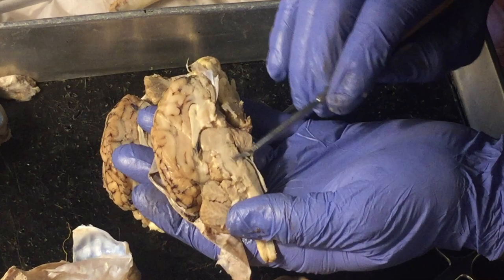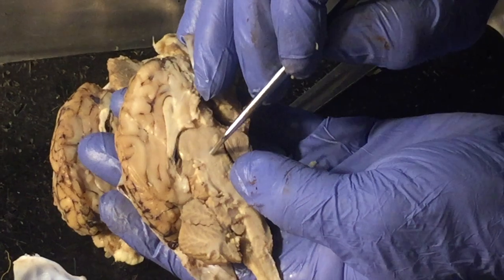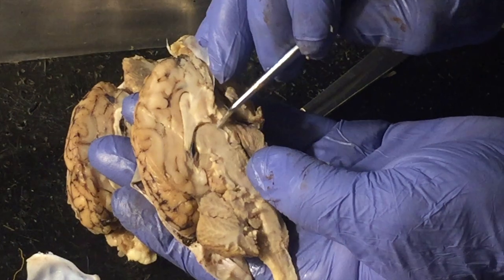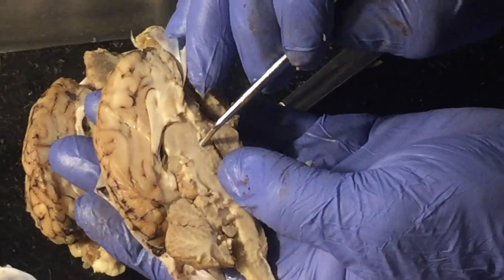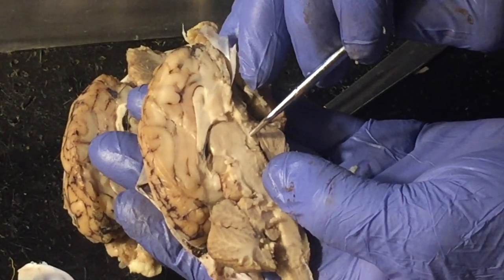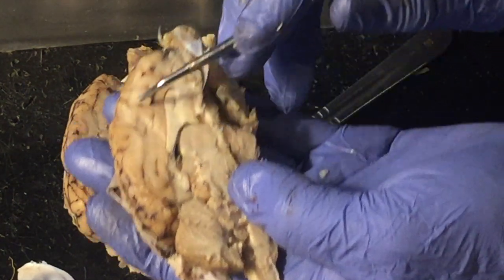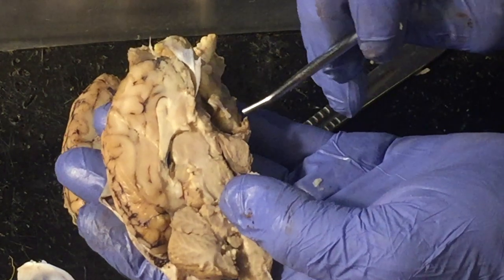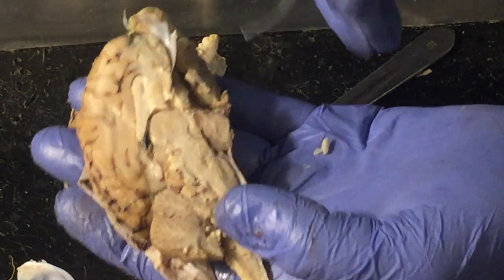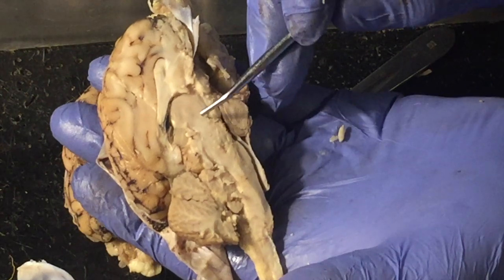The next structure that I want to show you is the thalamus. If you can kind of see this rounded structure right here, that's the thalamus, and there's actually a little opening right here. And the floor down below that rounded structure is called the hypothalamus. So the thalamus sort of decides what to send up to the higher brain function and where to send it. The hypothalamus controls your body's internal environment, if you will. It controls thirst, hunger, body temperature, things like that. So real important functions right here.